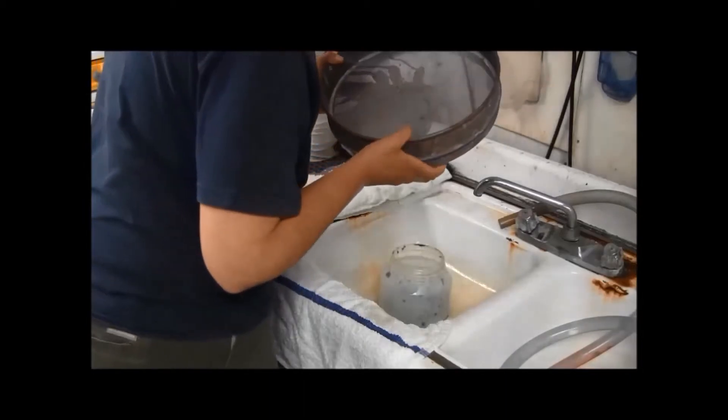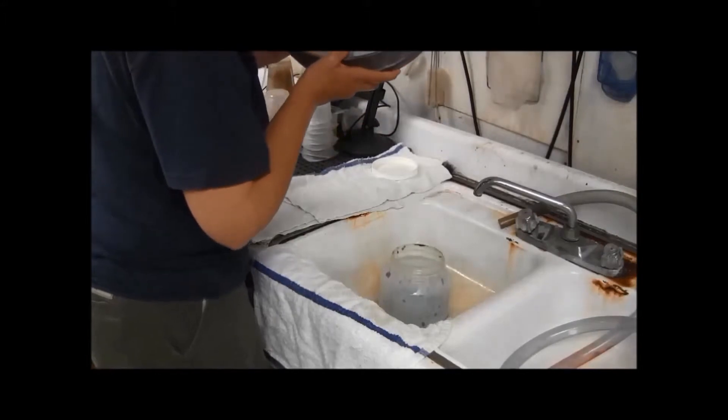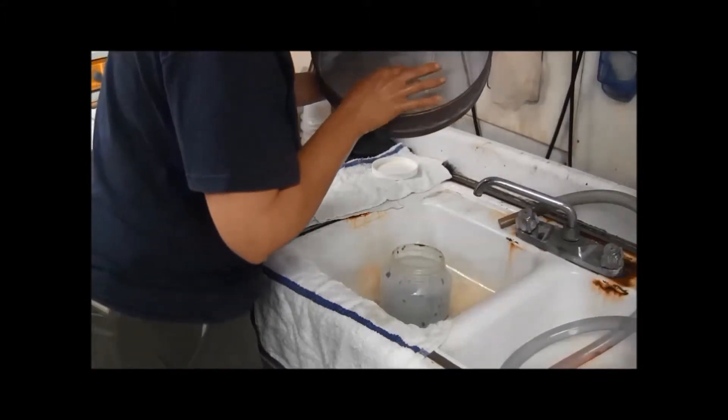Get all the stuff out from the screen as best as you can. Probably need some good lighting and a pair of forceps, but I'm not seeing anything in here.